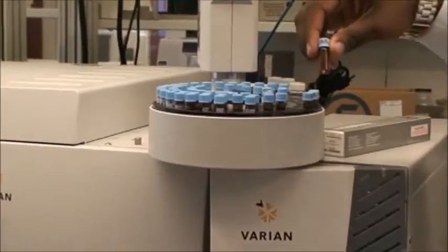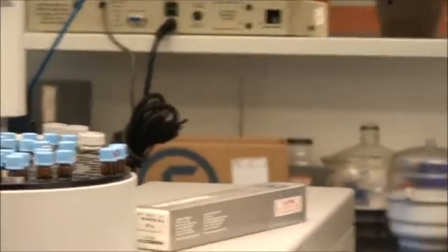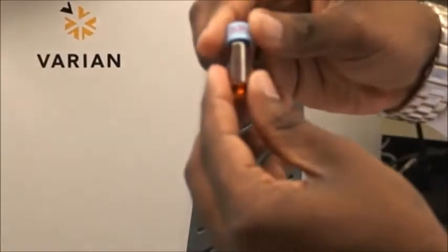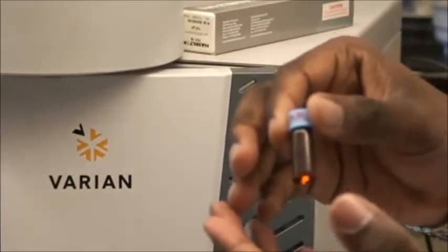One of the critical things about using GCMS is to make sure you have the appropriate concentration. The concentration needed is one milligram per milliliter of your sample, and you want to use a solvent volume of about 1.5 milliliters.